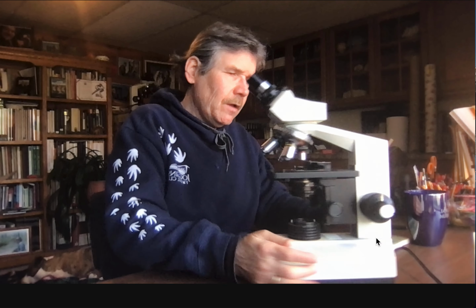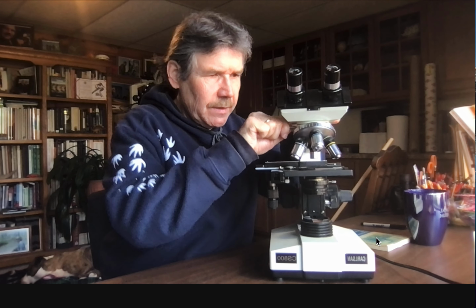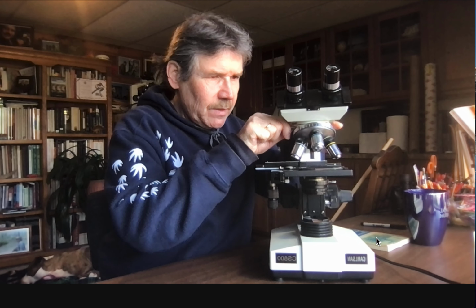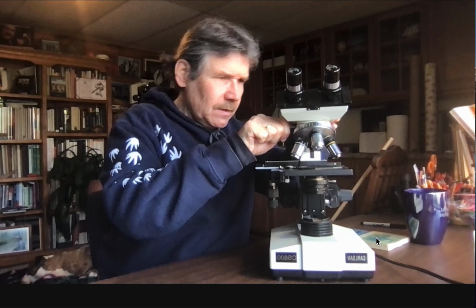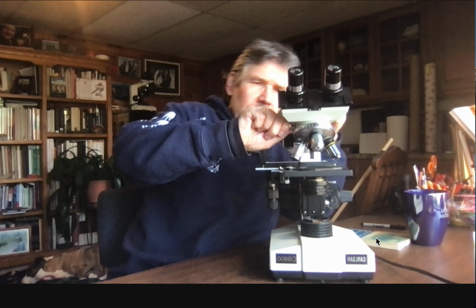Okay. Well, can we lock this thing in? Yep, that's what this little screw is right here. And that should lock it in place. I'm tightening it up a little bit, and it's pretty resistant right now to moving. There we go. I think I got it pretty straight. Got that tightened down, and that should last. If you need help, of course, call us over, and we'll help you fix that. We'd rather help you than have you break something because you weren't quite sure what you were doing.